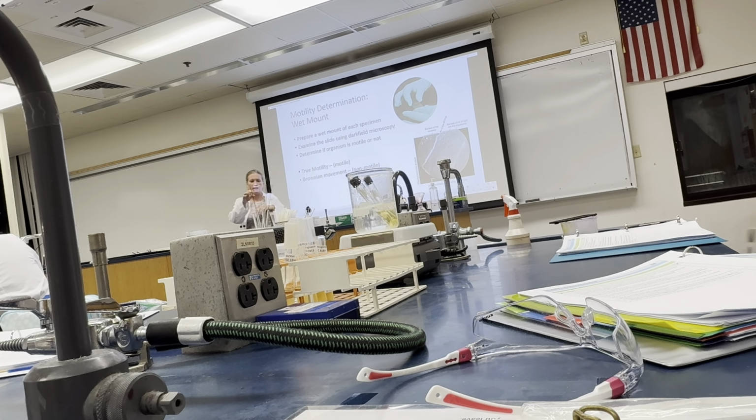Then you're going to put the cover slip on top and put it under the microscope at 10x, okay? You will then put in your dark field diaphragm, and while the dark field diaphragm is in place, you have to be at maximum. So the rheostat is turned up to maximum, highest light possible, rheostat all the way up, and the iris diaphragm all the way open. You want as much light as possible coming through.